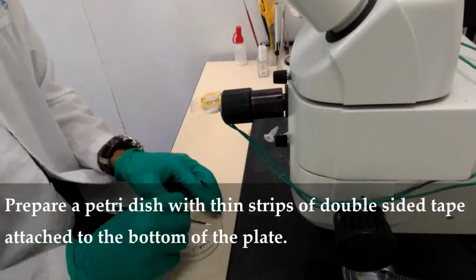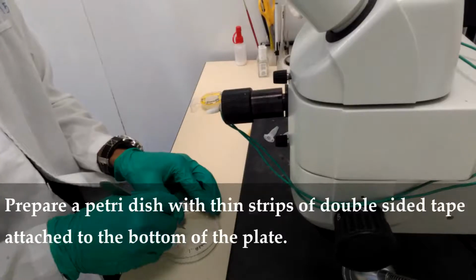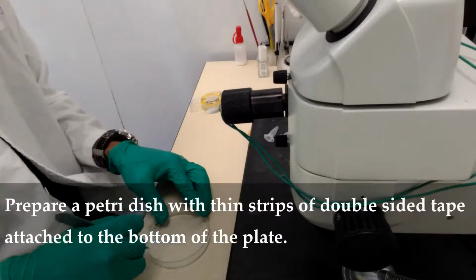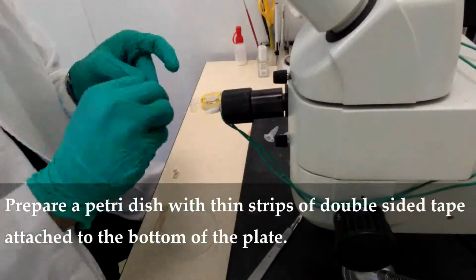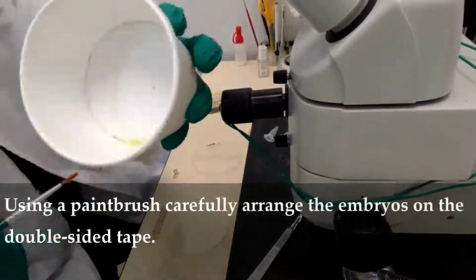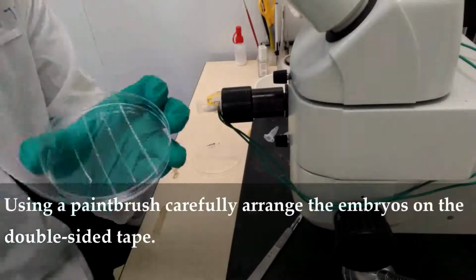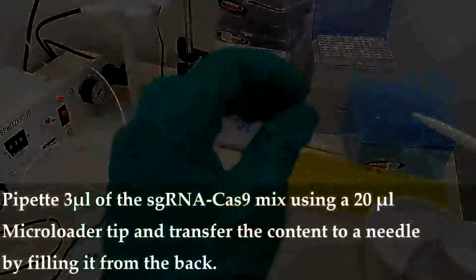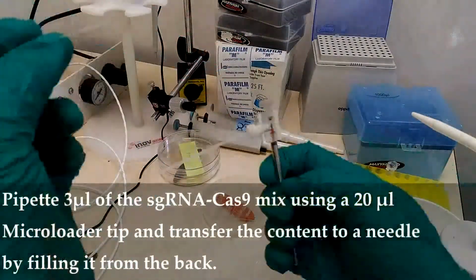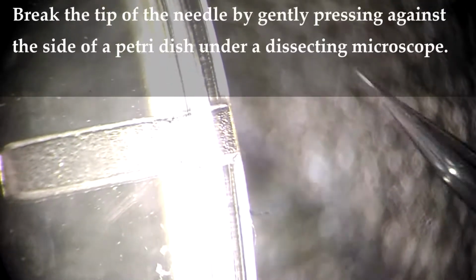Preparation for injection. Prepare a Petri plate with thin stripes of double-sided tape attached to the bottom of the plate. Using a paintbrush, carefully arrange the embryos on the double-sided tape. Pipette 3 microliter of the sgRNA Cas9 mix using a 20 microliter tip and transfer the content to the needle by filling it from the back. Break the tip of the needle by gently pressing against the side of a Petri dish under a dissecting microscope.